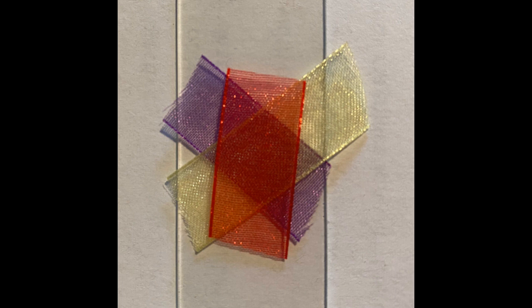Now we will add the yellow on top of the purple. So when we try to focus it, you can see the purple come into focus and then the yellow. But notice we can't focus on both of them at the same time. So now we'll put the red on the top layer. And now you can see we focus first. We'll find the bottom is purple. That comes into view. And then that will get blurry as we focus and keep pulling back to see the yellow nice and clear. And then finally, we'll focus on the top layer, the red.